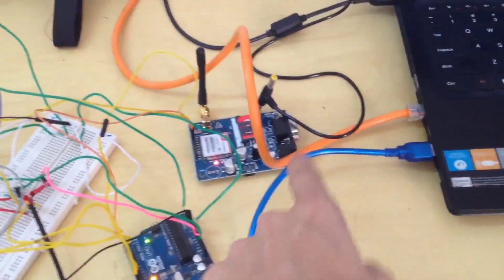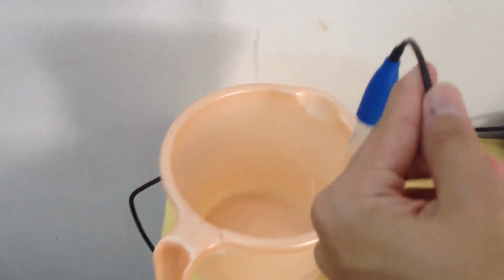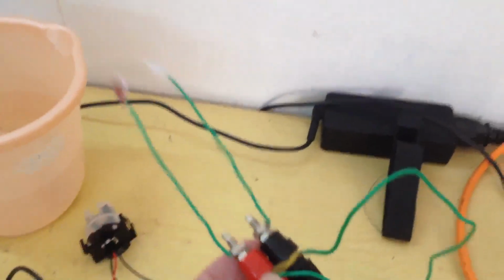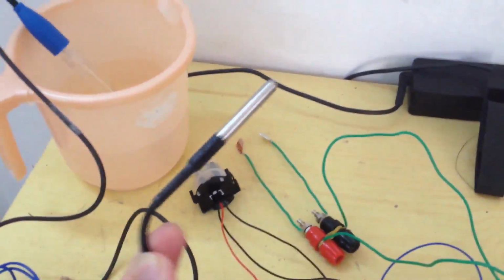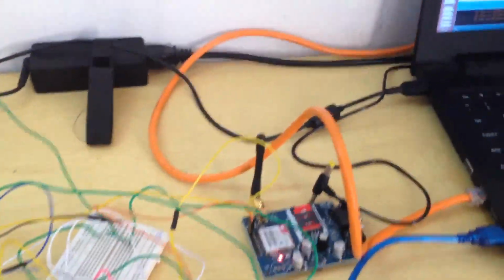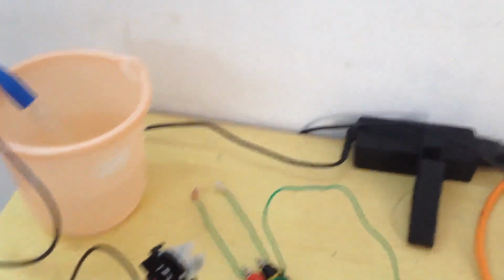Let me first of all show you the hardware which we have used for the project. Let me take you through the sensors which we have used. This is the Arduino Uno and the GSM module which we have connected with the PC. This is the pH sensor. Next is the ultrasonic sensor, which is this tiny thing. These two strips of aluminum make up the conductivity sensor. This is the temperature probe, DS18B20. And finally, we have the turbidity sensor.